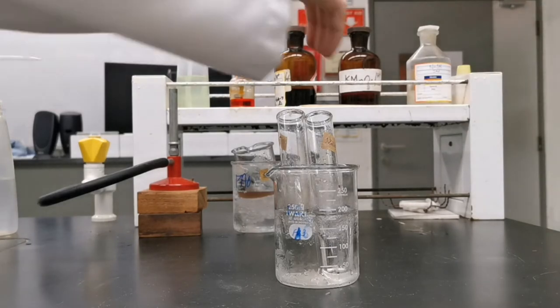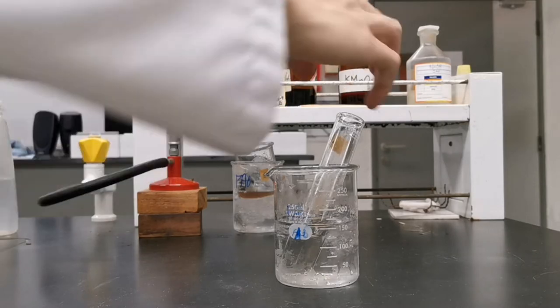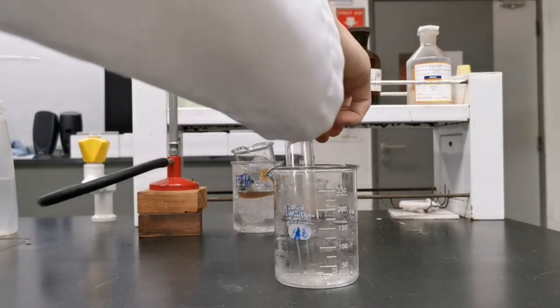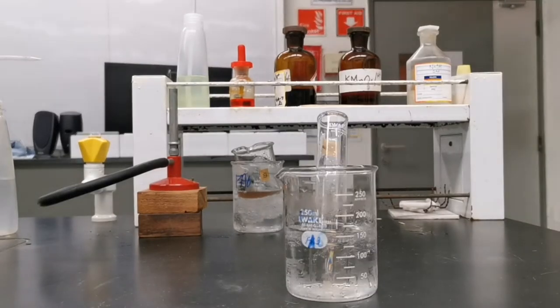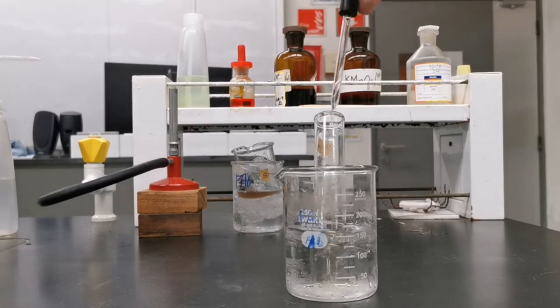I give it a small stir to ensure all reactants have reacted completely. I want to test whether the red dye will evolve when naphthol is added.